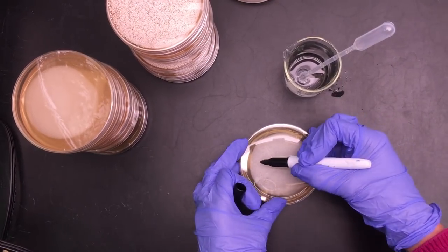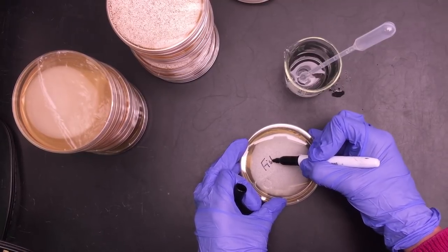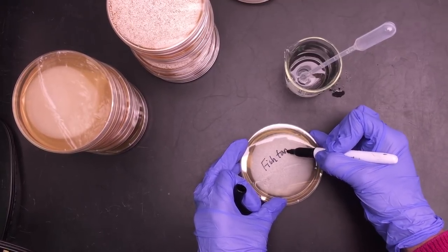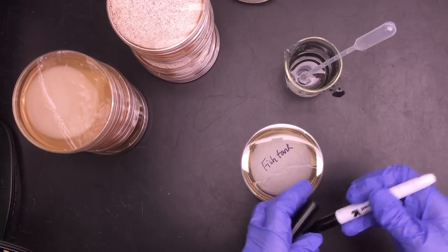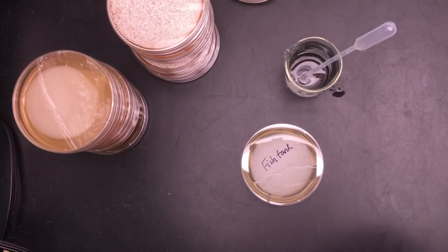And I'm going to label this fish tank. And I'm going to seal it up.